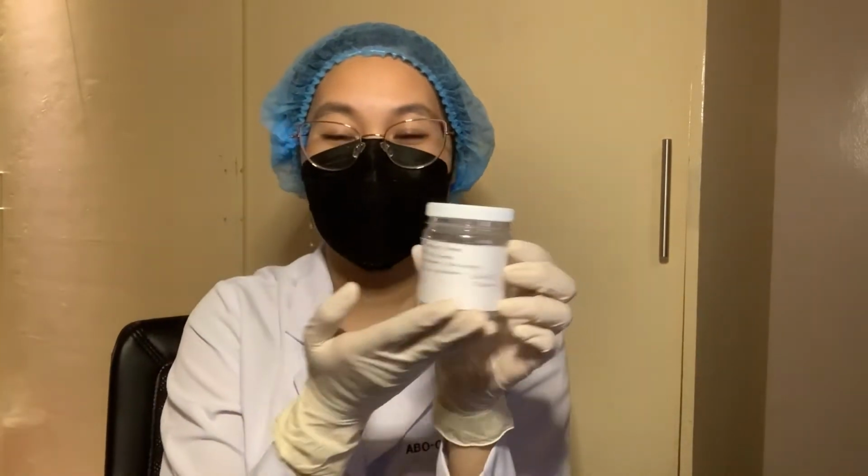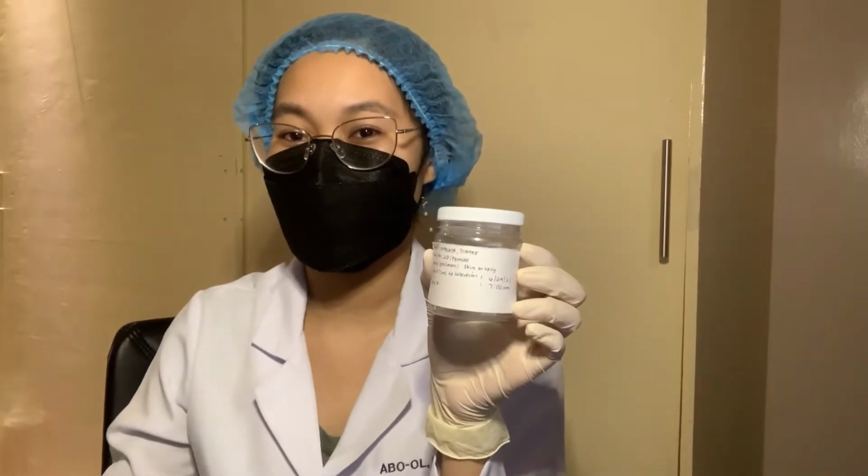My name is Krisha and I'm your medtech for today. I'll show you how we properly accept samples in the laboratory. I have just received a tissue sample and the request form right here.